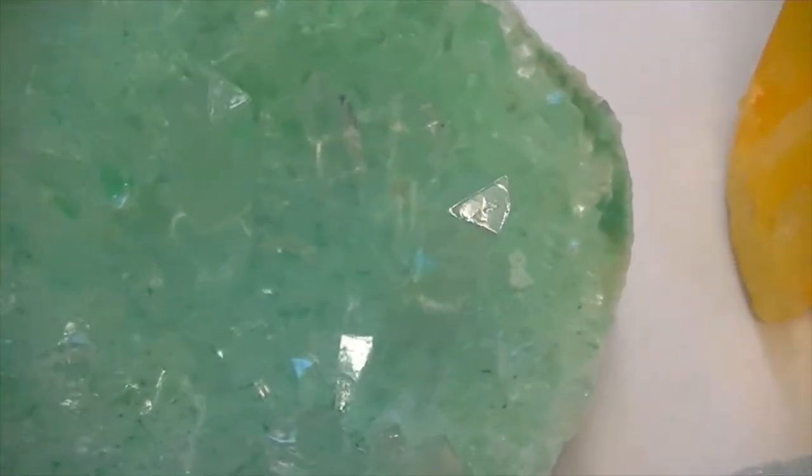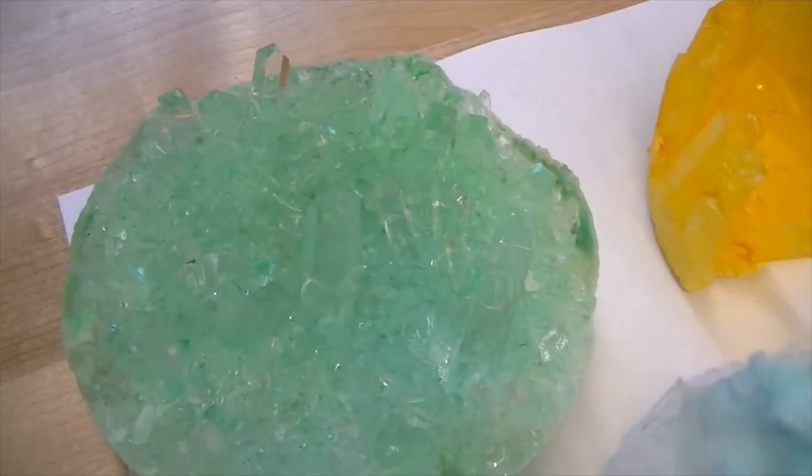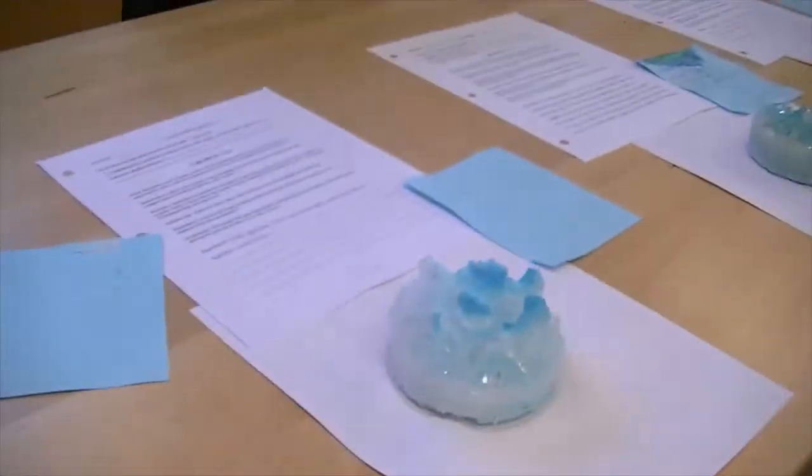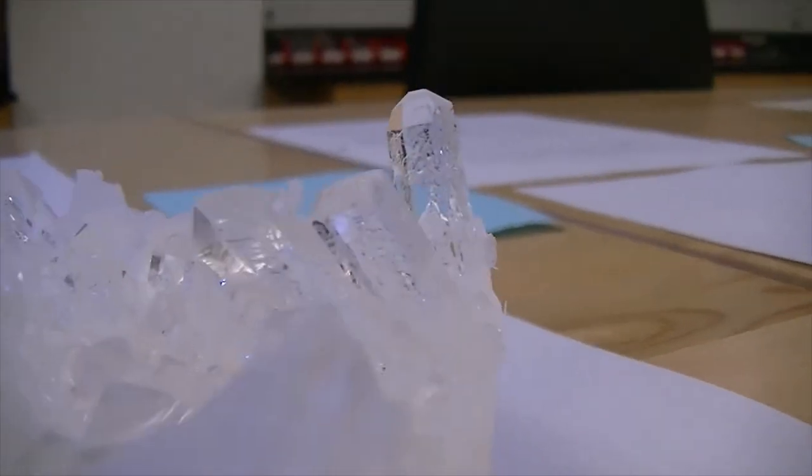Then look at the crystals that look like Cheetos — a little bit thicker. You can tell the students used a lot of food coloring, an awful lot of yellow to get that look. Here we have some very thick crystals, and you can tell the green sample didn't have a lot of food coloring — very little food coloring compared to the one next to it. These students used a great deal of food coloring, and the blue one used a moderate amount. And here's a crystal structure grown without any food coloring whatsoever.